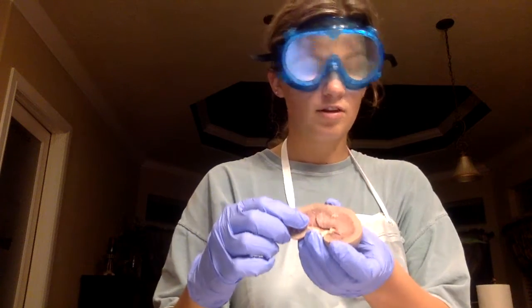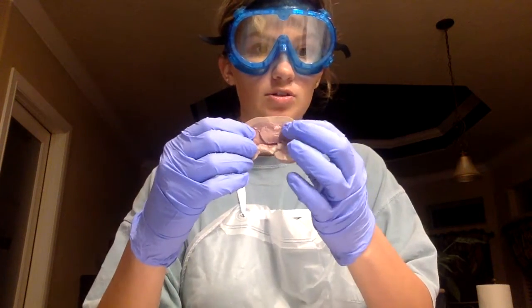And then the renal papillae, where's that? I lost it. Oh, it's the inner part of the renal pyramid where the tubules empty urine. And then the renal column is the tissue in between the renal pyramids.